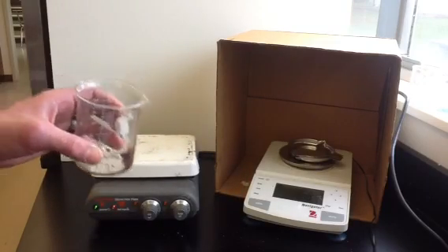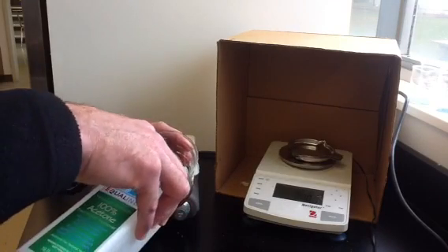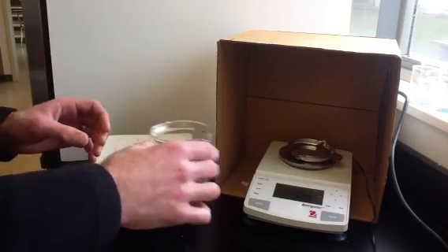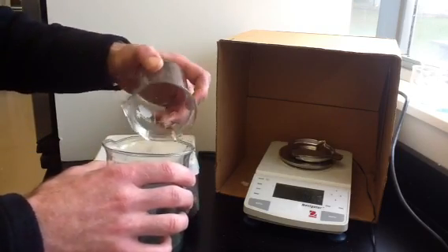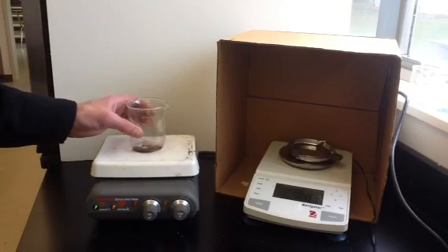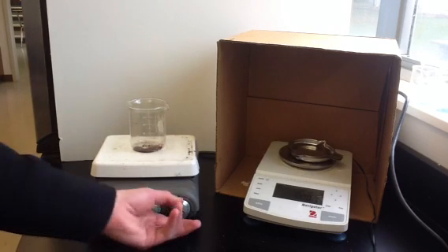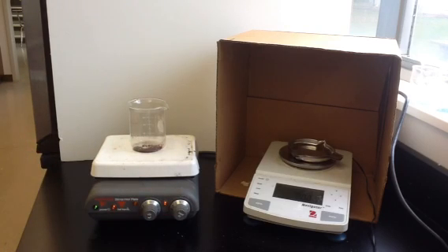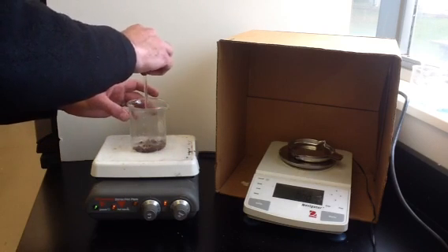We're going to do the same thing one more time, but this time using acetone. Acetone is a more volatile liquid, and that's going to help it evaporate quickly and clean up our copper. We'll pour off as much of the acetone as we can, then set the beaker on the hot plate to dry. We need to be careful because acetone is quite flammable, so we'll keep the hot plate just on low. This will cause the acetone to evaporate and dry out our copper.